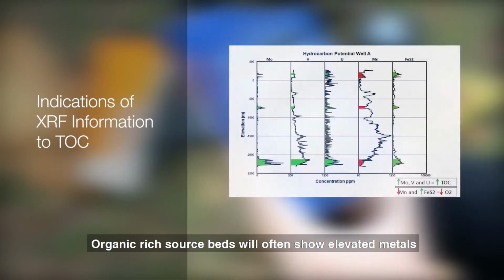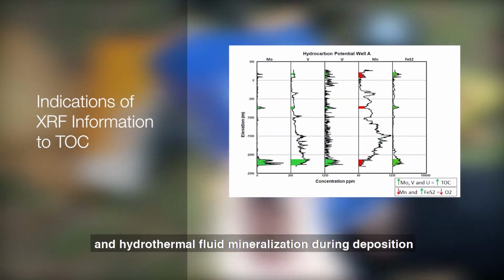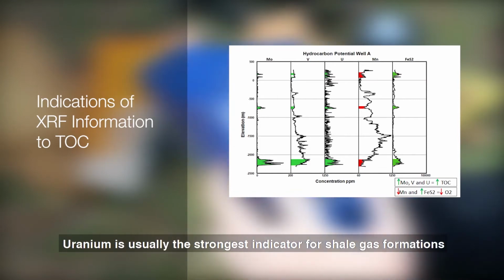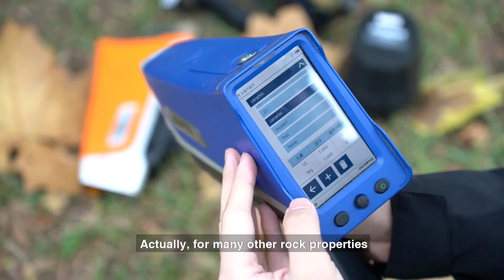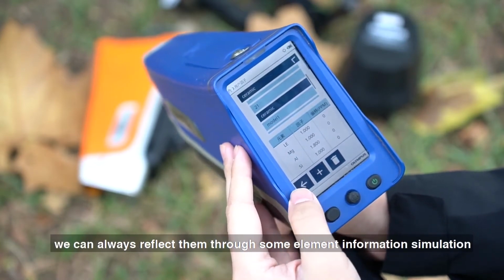For example, the TOC, total organic carbon. Organic rich source beds will often show elevated metals due to reducing conditions and hydrothermal fluid mineralization during deposition. You can relate the concentrations of these elements to the TOC. Uranium is usually the strongest indicator for shale gas formations. Actually, for many other rock properties, we can always reflect them through some element information simulation.